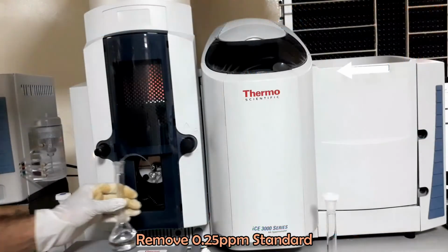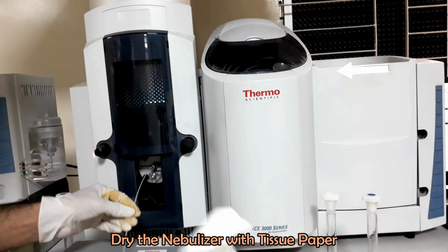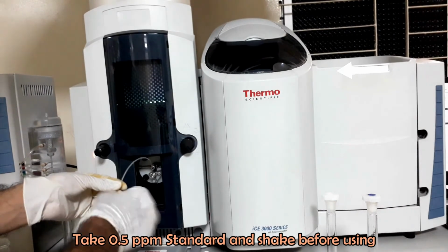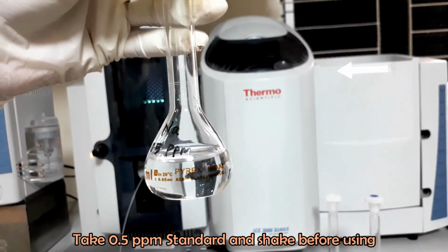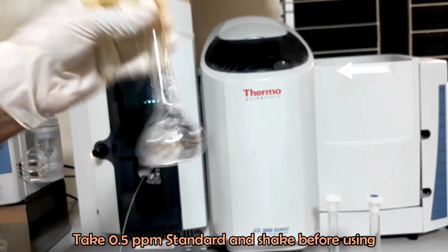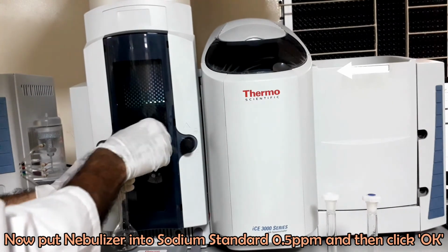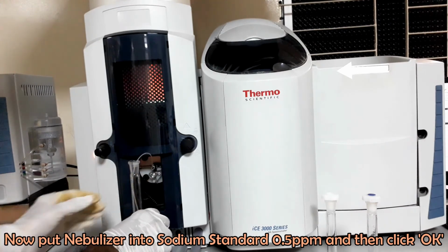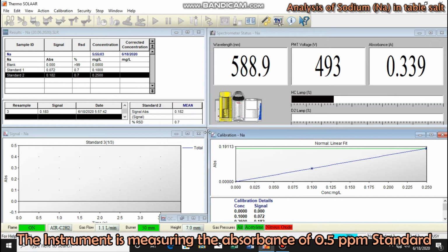Now the instrument is asking for 0.5 ppm sodium standard. Dry the nebulizer. Shake the standard flask and replace the 0.25 ppm standard with 0.5 ppm sodium standard. Click OK. The instrument is measuring the absorbance of 0.5 ppm standard.